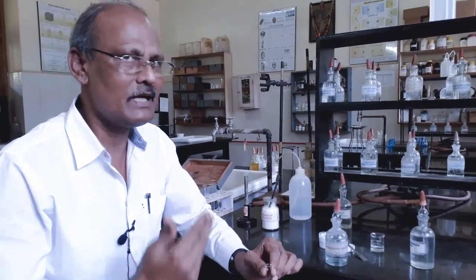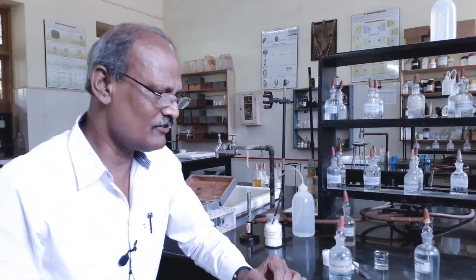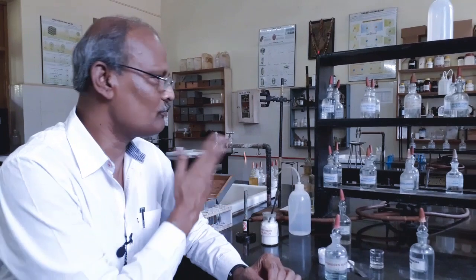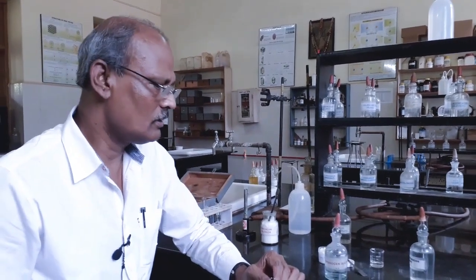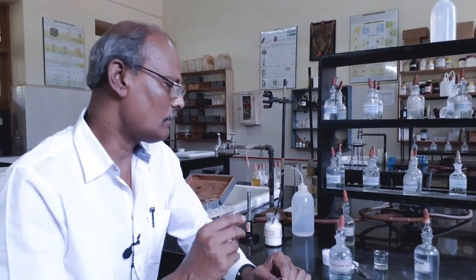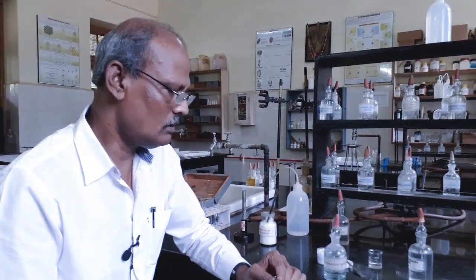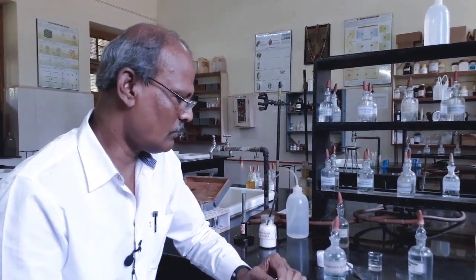college, and that leaked hydrogen sulfide gas will be inhaled by all other students working in the laboratory as well as the people, students, teachers, staff moving all around in the college. They are going to inhale the poisonous gas and that leads to environmental pollution and is also toxic to the students and staff in the college.